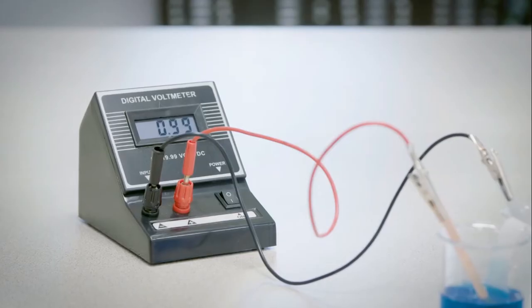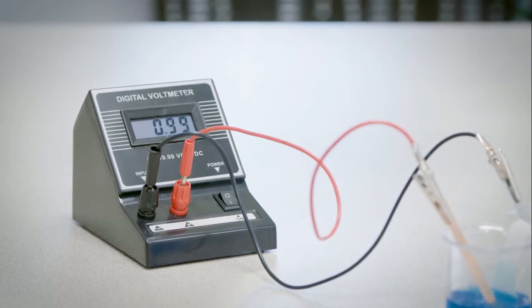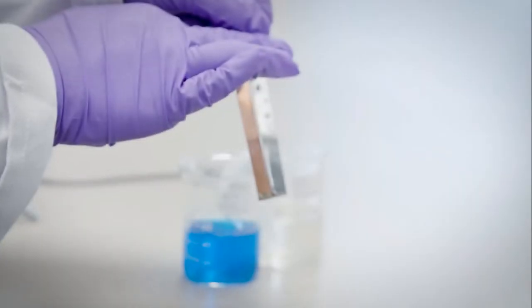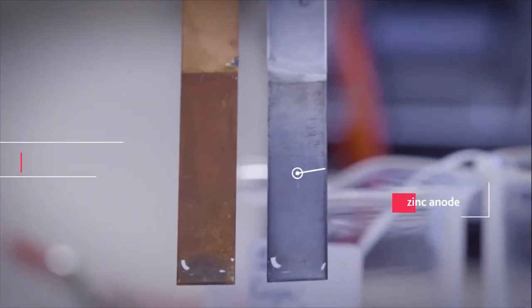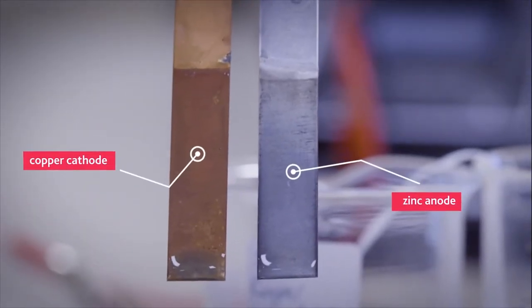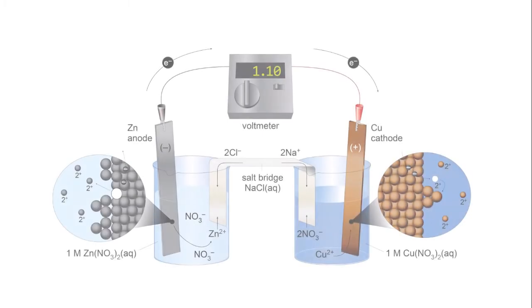However, the voltage being produced by it is lower than at the start, and there are also observable changes to the electrodes. The zinc anode has become tarnished and has started to degrade around the edges. The copper cathode has freshly deposited copper on it and appears slightly thicker than the zinc anode. Here is a visual summary of the whole process for the zinc-copper cell.